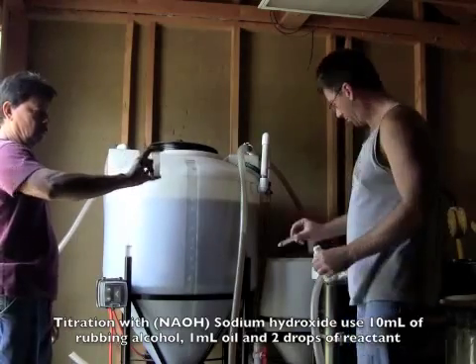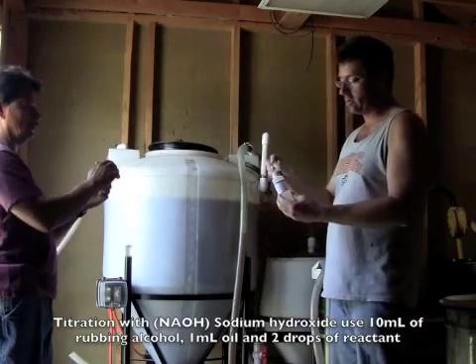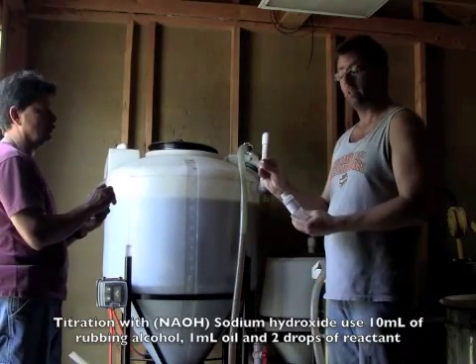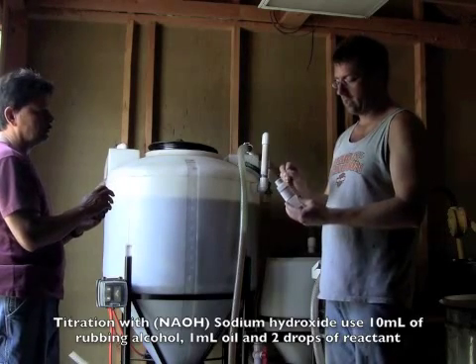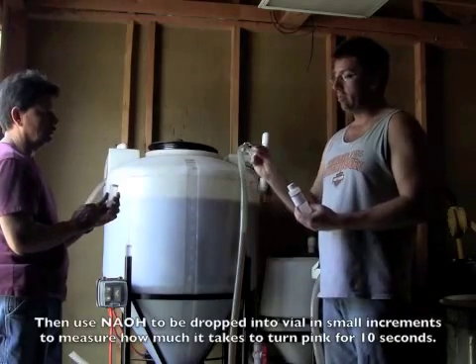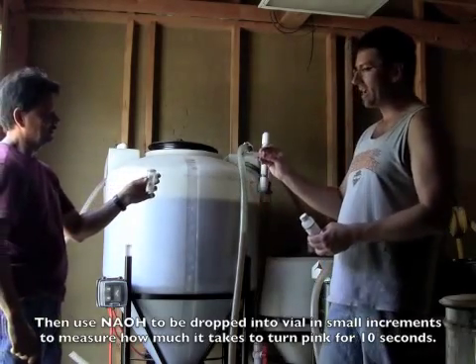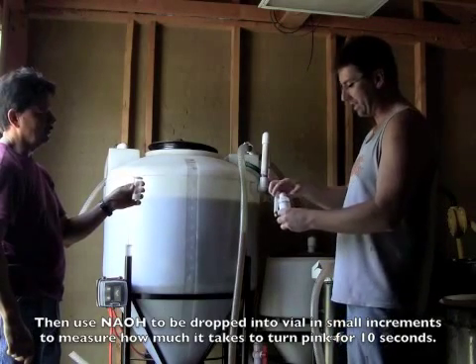This is the sodium hydroxide mix and we're going to draw out just a little bit of it — start with two milliliters, but we'll probably use one. We're going to add it a little at a time to the vial, shake it up, and watch it turn a light pink. We need the pink to stay active for more than 10 seconds.